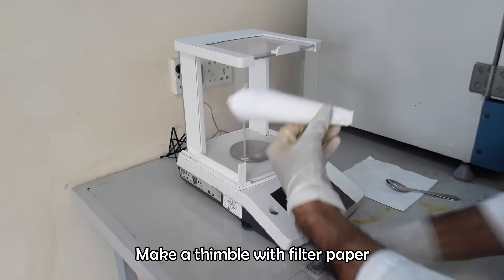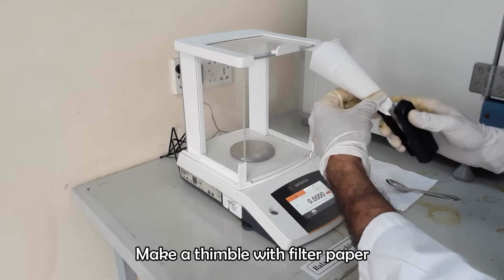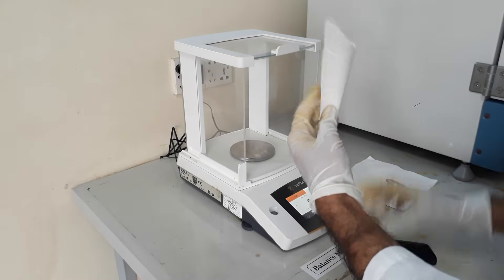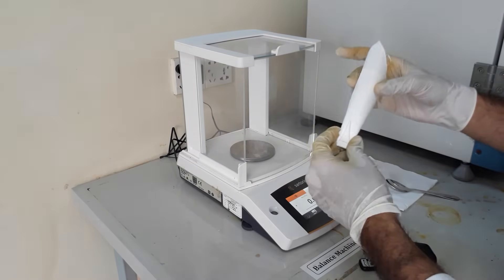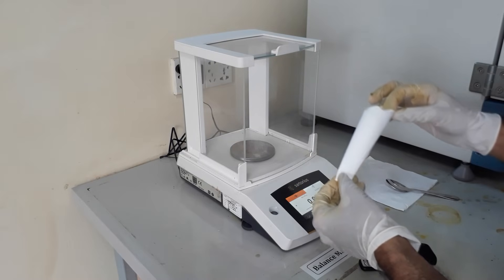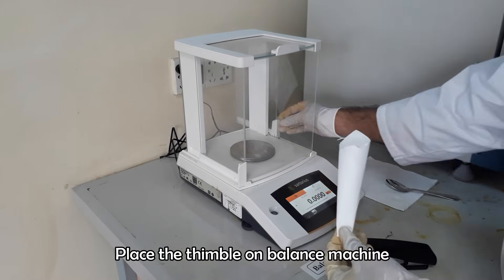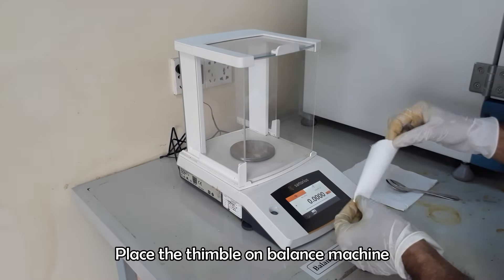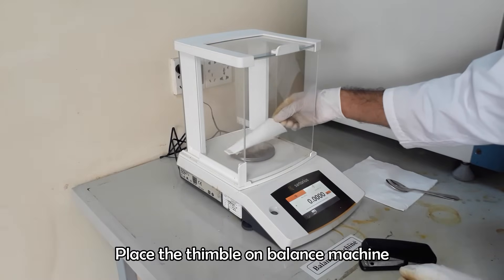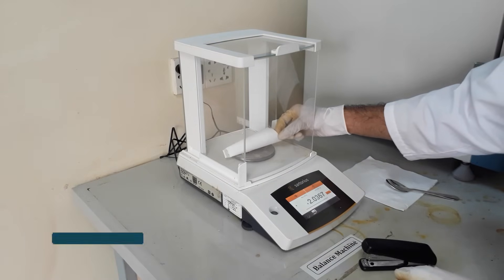Staple one end of the thimble to seal that end. Place the thimble on the balance machine and tare its weight.